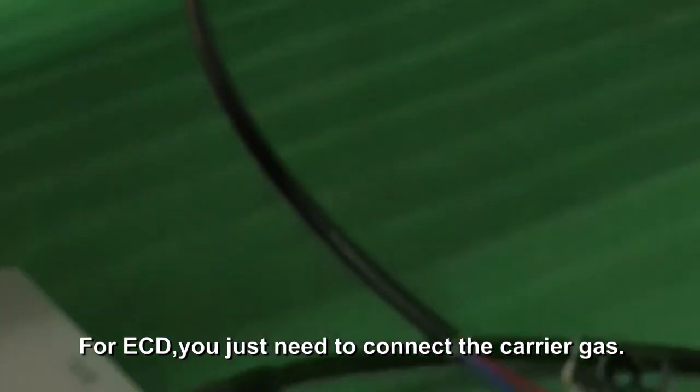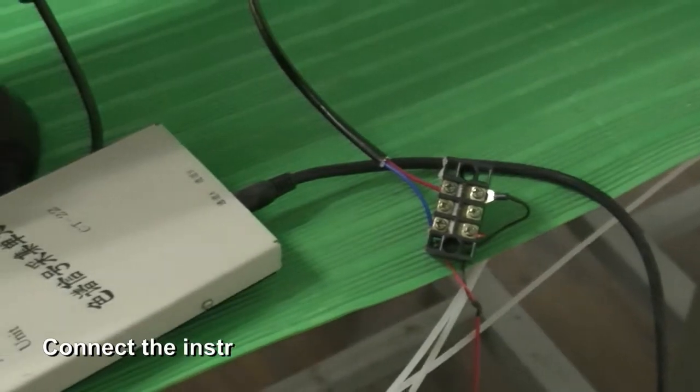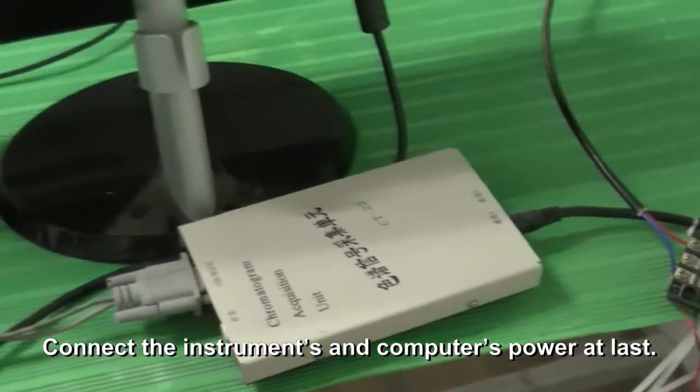For ECD, you just need to connect the carrier gas, then connect the instrument to the workstation and PC. Connect the instrument and computer's power last.